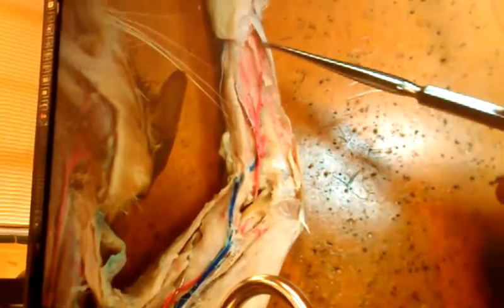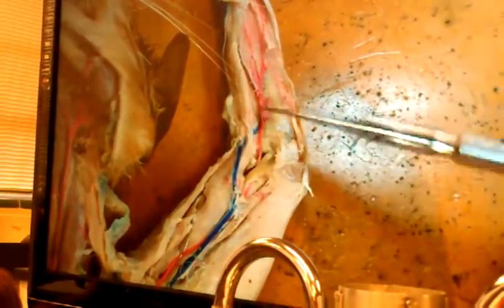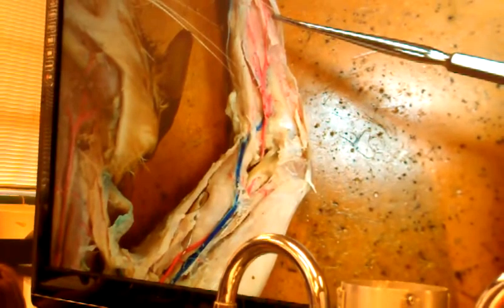But then there's a smaller one, Mr. Gilmore, that goes lower. His name is ulnar. So if I got radial that keeps going medial toward the thumb, the ulnar goes toward the pinky, and we're going to call him ulnar. Does that make sense? Believe it or not, you should have a good understanding of all the main vessels that go from the arterial supply that goes from the heart to the wrist or hand.